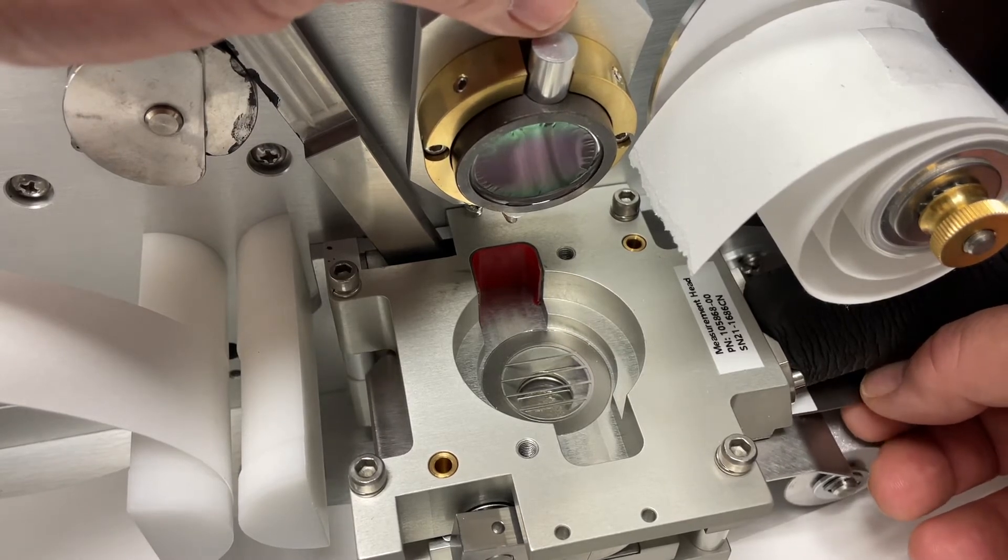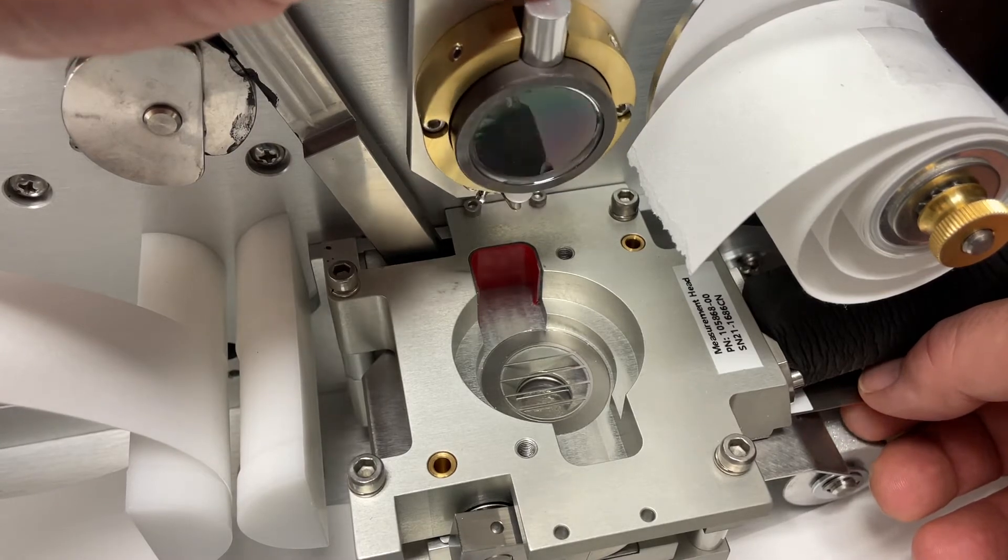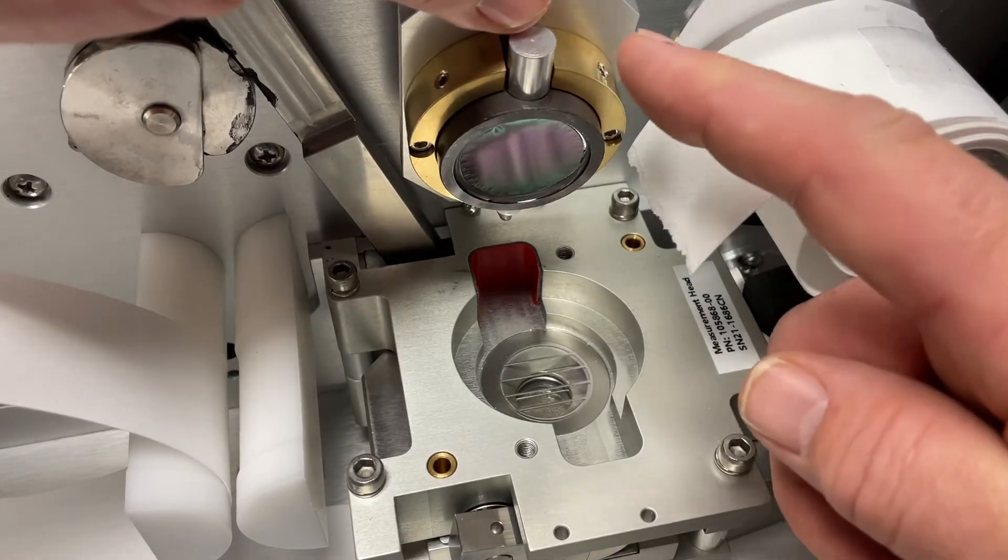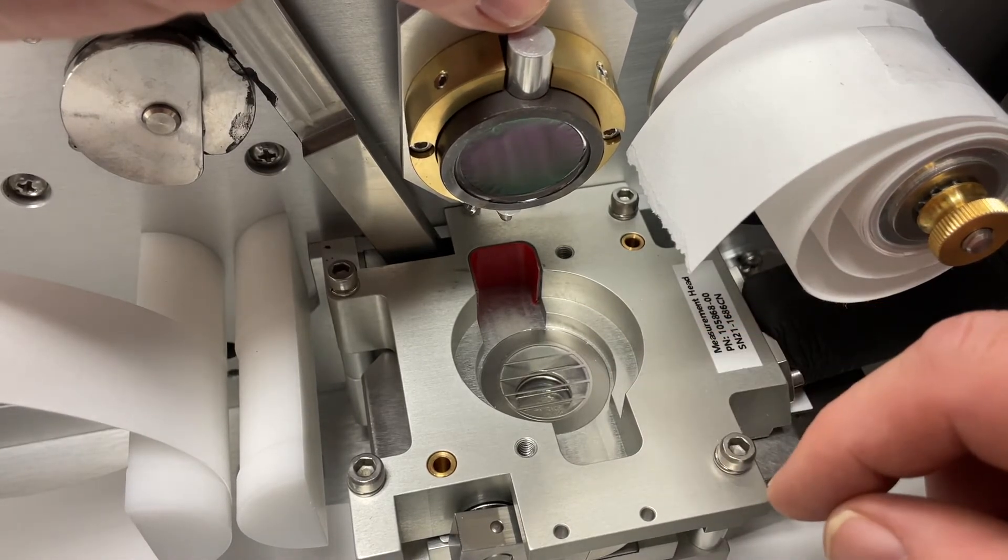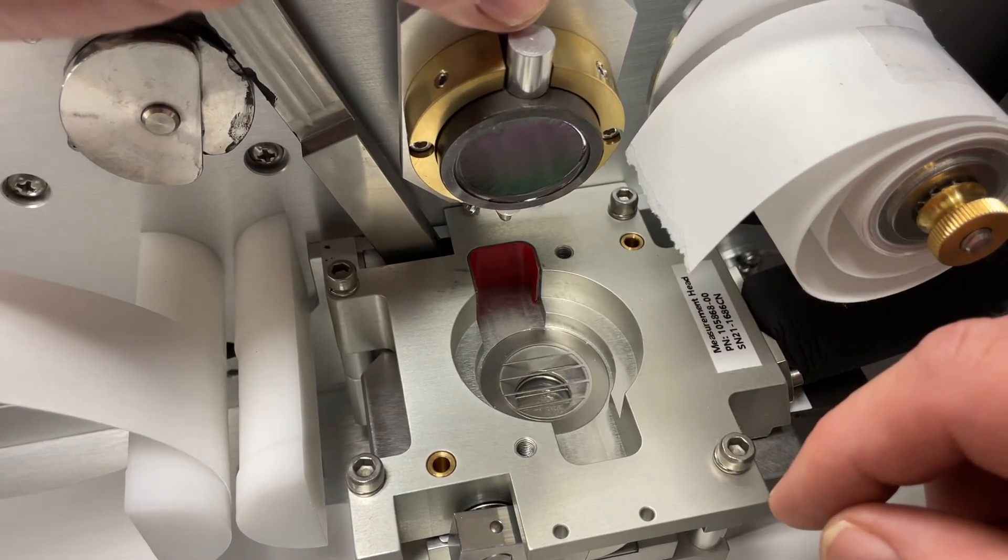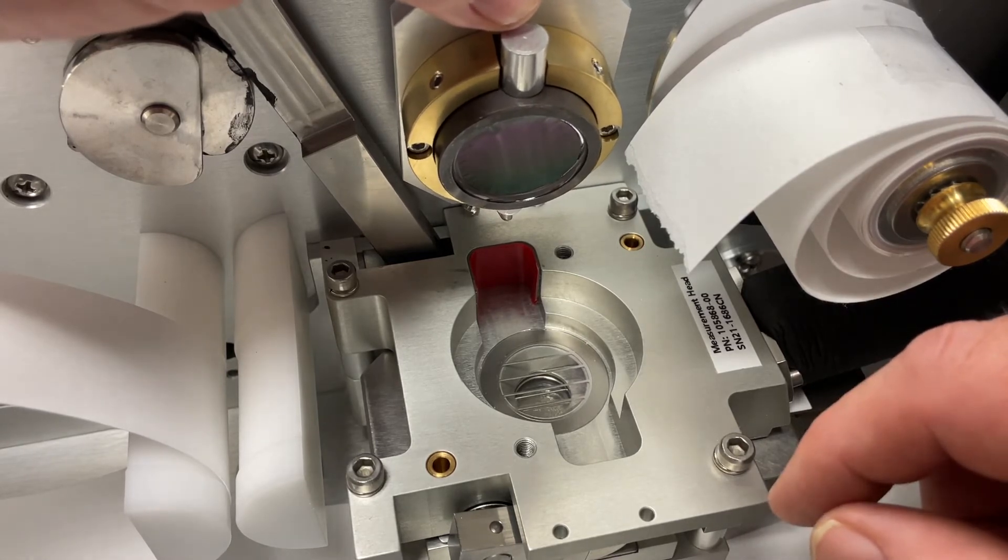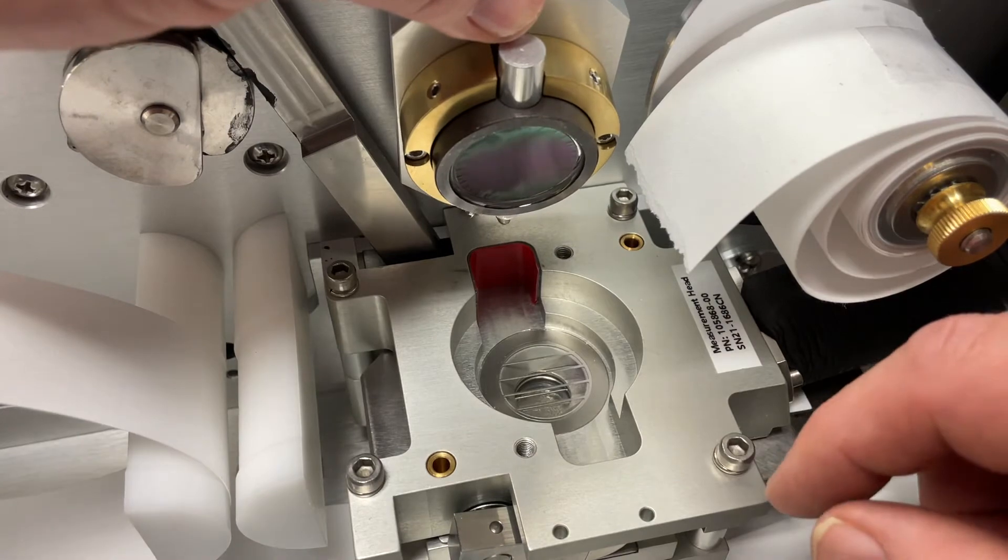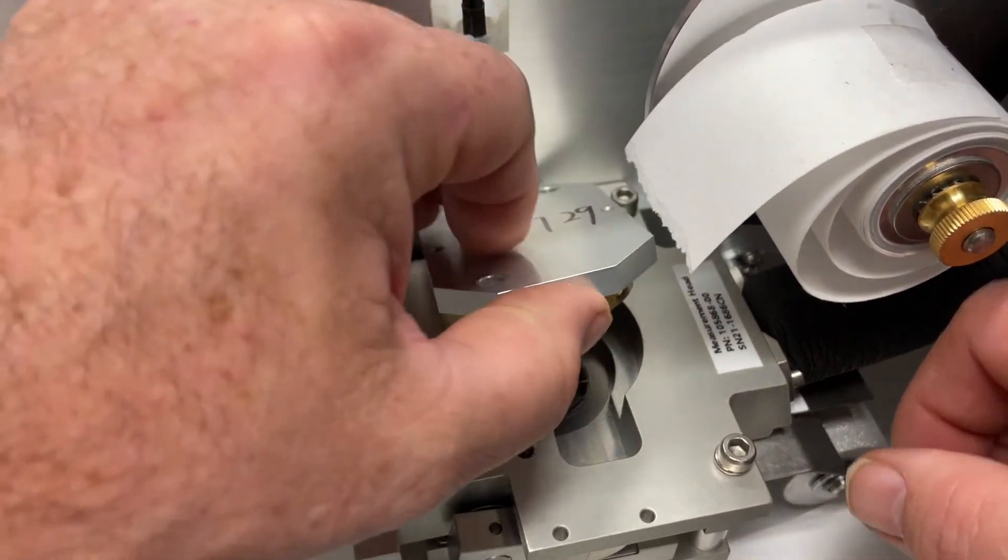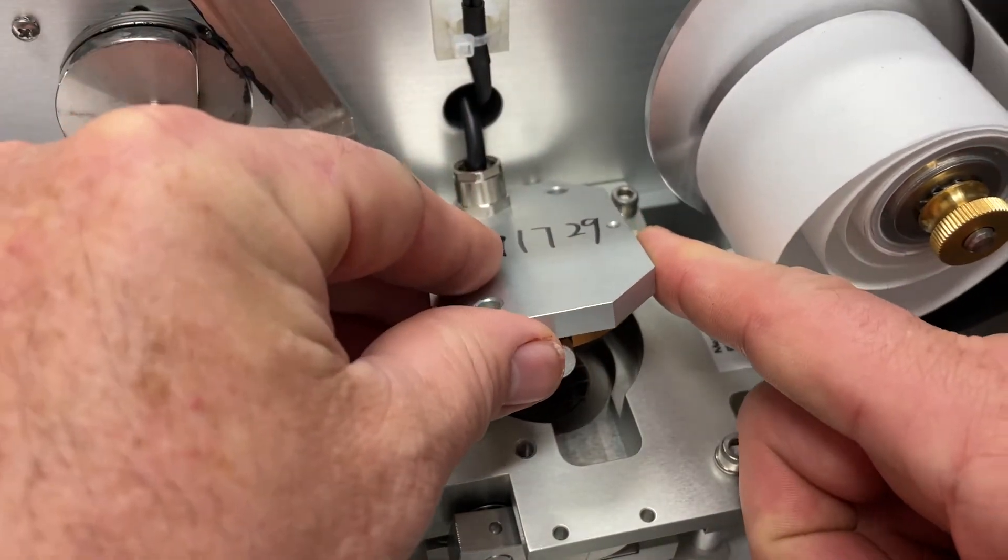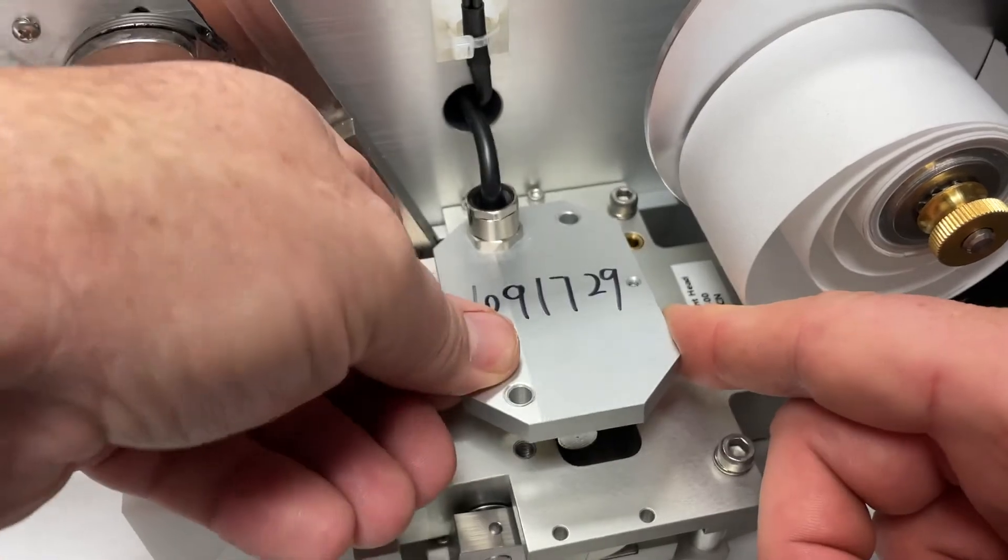That needs to be centered underneath the beta detector, and that's why they give you this bracket to guide you in. So when you're sliding that bracket in from the right, you're putting that foil in the dead center underneath that detector. When the beta rays from the detector are going through the foil, it gives you either that zero reading or it will give you the other two readings: 1225 micrograms and 2522 micrograms.